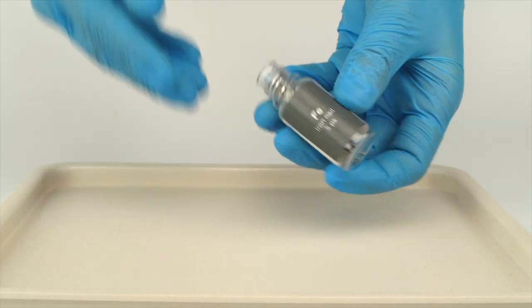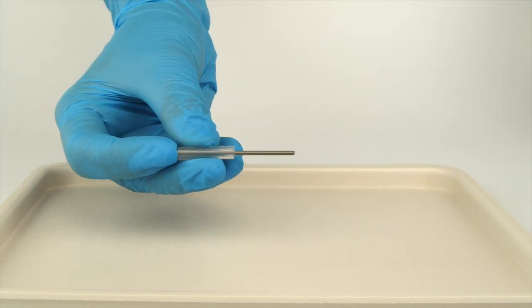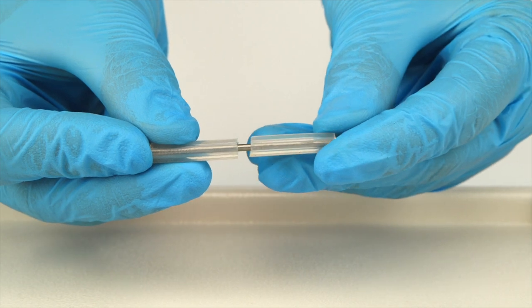Take two nails. Put the rubber tubes on the first nail, leaving approximately a two millimeter distance between them.